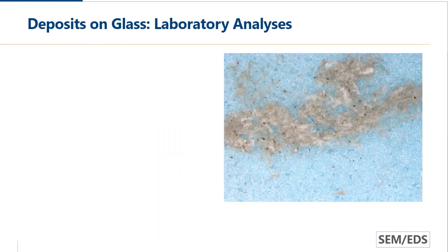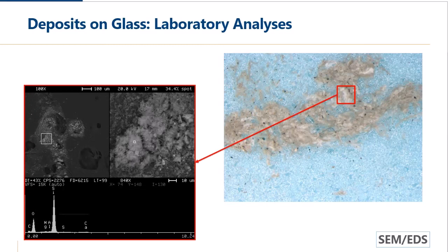So one of the ways that we find it easy to look at deposits, and it depends, sometimes it's better to look at it directly on the specimen. Sometimes it's useful to remove it. So in this case, we took the scrapings from the site visit, and here's a photograph of the scrapings. And you can see there's some brownish colored dirt, some black spots, but also these white fluffy materials that look like the white stuff we saw in the micrograph. So again, taking some of that material, putting it in the SEM, and there on the upper right, you can see the fluffy white material. We do the EDS analysis and see that it's primarily silicon and oxygen. We're not seeing much calcium or sodium from the soda lime glass. So we know that these deposits are a little bit different than the glass itself.